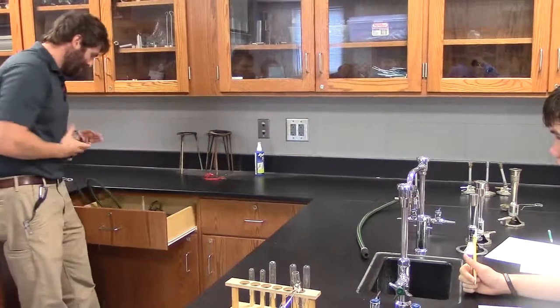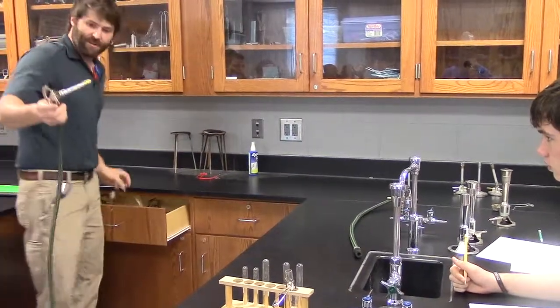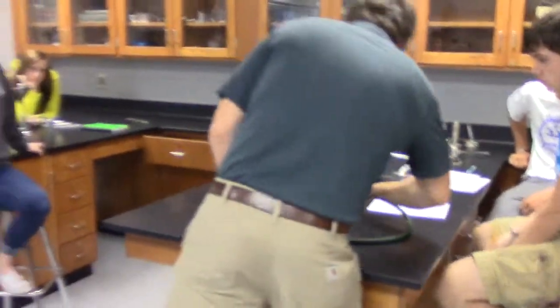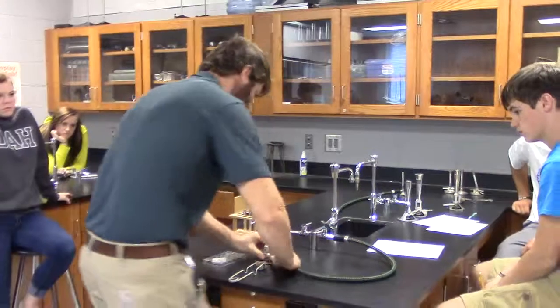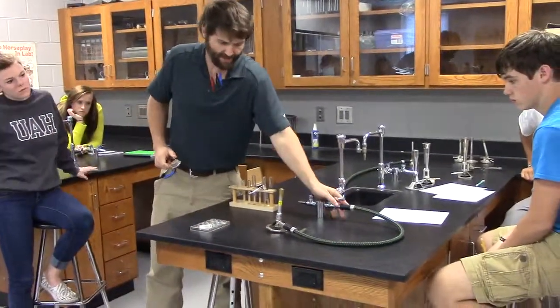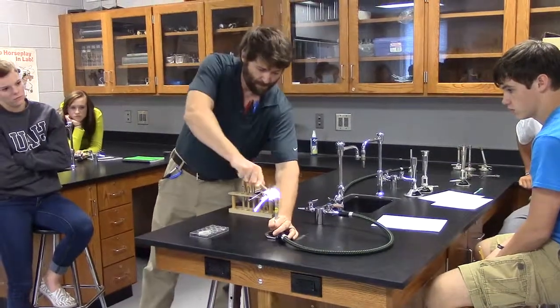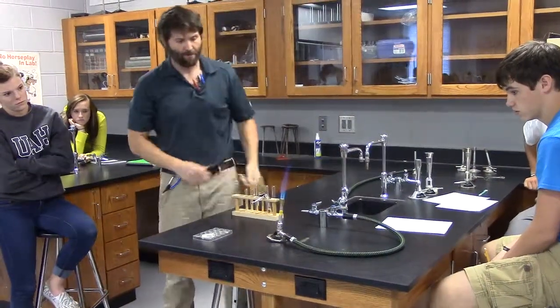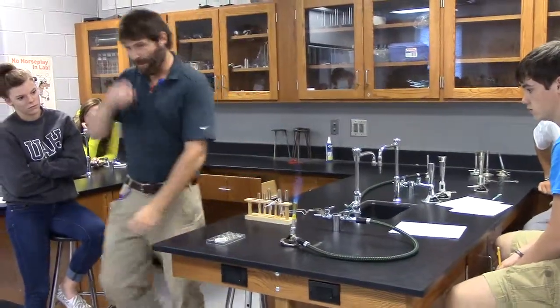Alright, so I'm going to get me a burner out. I'm going to get a striker out. Oh, well, this is like a brand new burner. So let's get us a burner. We've already gone over how to light burners. So I'm going to get my burner over here. Gas on, air off. There we go. Burner's ready to go.